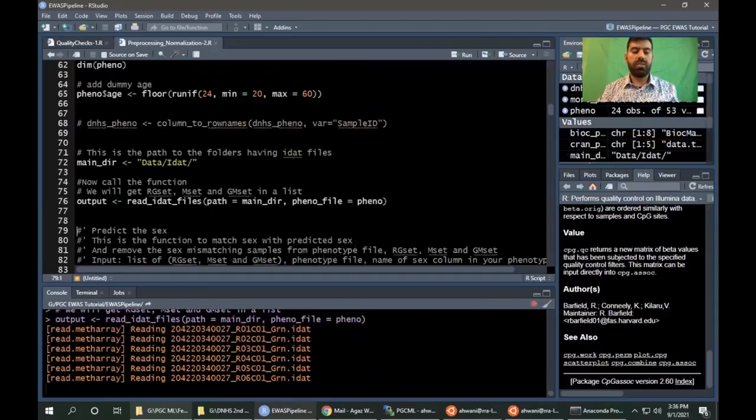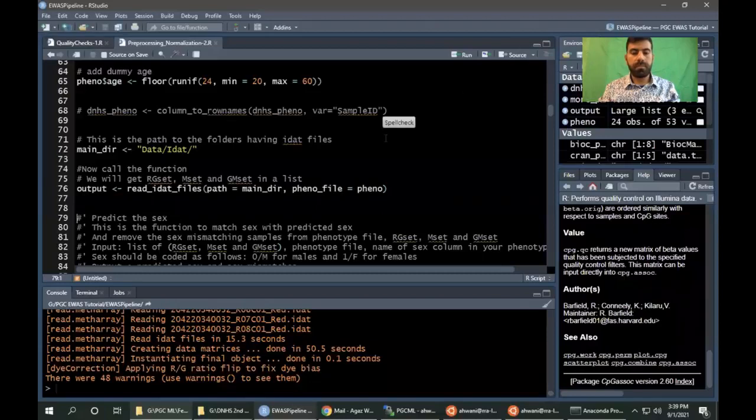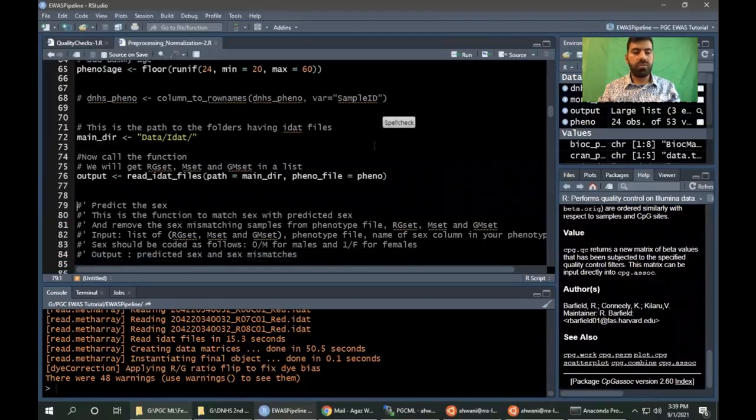So we will load the data first. As you can see, it is loading the red and green channel data, and it will perform dye bias correction because we have data from two different channels, that is red and green, and it will perform SSNoob normalization. There are various approaches, but in this part, we will use SSNoob. Followed by that, we will do sex check. We are almost done.